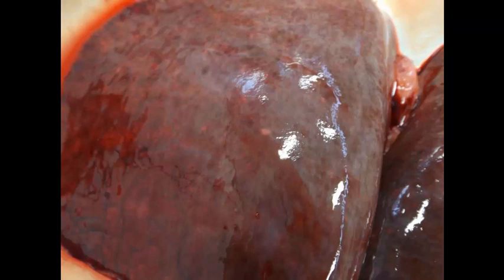This one's a little tough. We're up close, and when you get really close it's often difficult to distinguish a lobe of the lung from a lobe of the liver. One of the things I'm looking at here is — if you look — there are some rib impressions, very subtle, right here. And then you can see the interlobular septa, which are expanded because the lung is very edematous. There are some little white dots which may represent foci of necrosis. If I'm told it's a foal and there is an interstitial pneumonia with edema and maybe necrosis, equine herpesvirus type 1 is going to be at the top of the list.